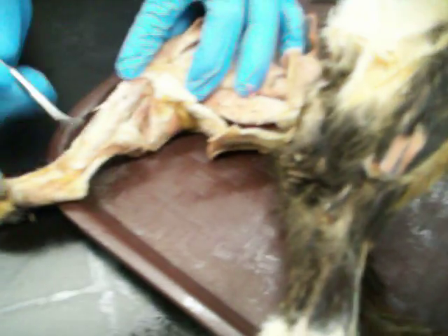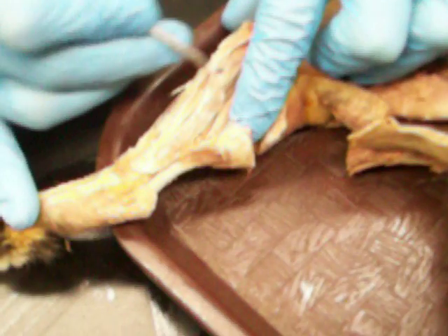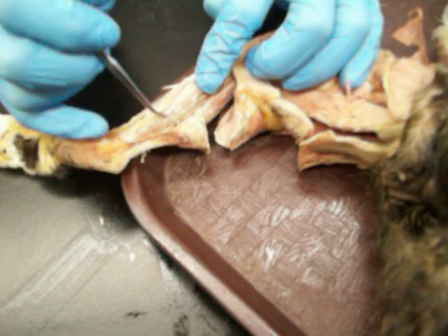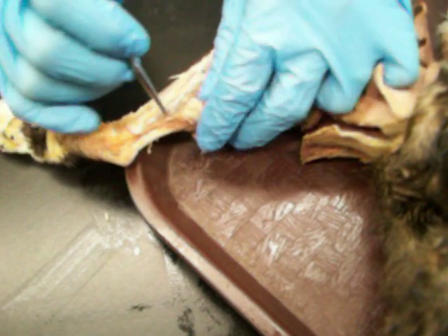Going backwards, here's the tibia. Finding just the tendon, which is right there — that's the tibialis posterior. And here's the flexor digitorum longus. You can see the muscle belly for the flexor digitorum longus, and just a little bit farther is the flexor hallucis longus, right there. That's the muscle belly right here, right below the soleus — so the soleus sits right on top of the flexor hallucis longus.